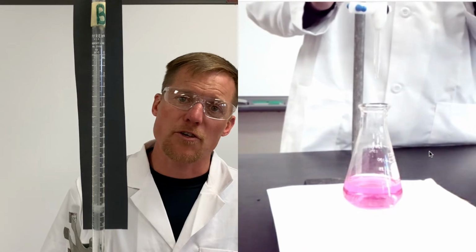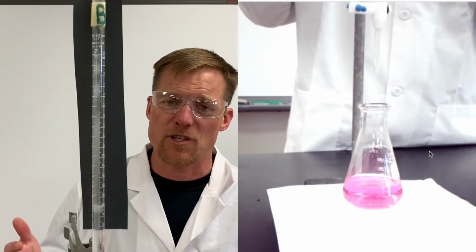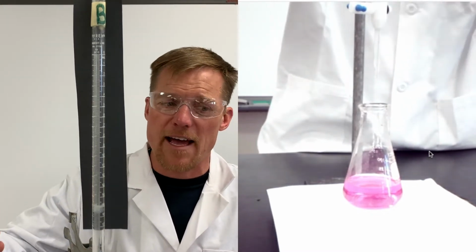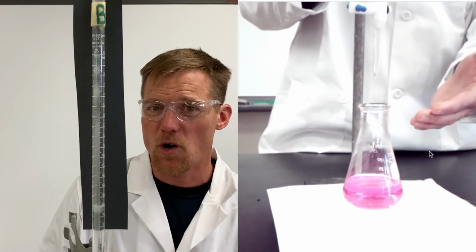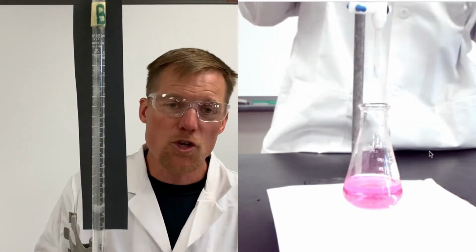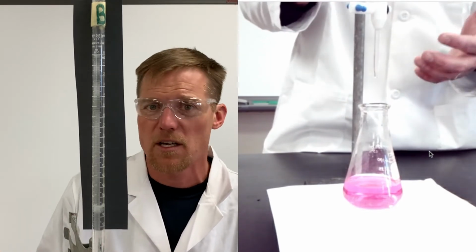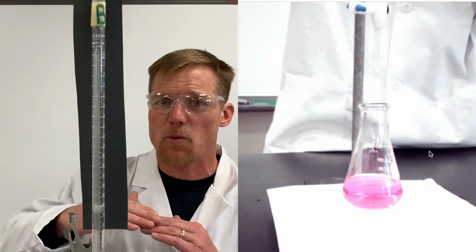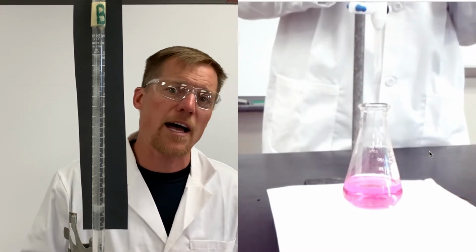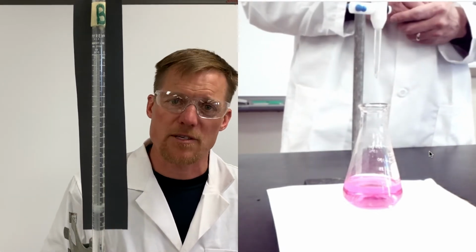The lab calls for using 15 milliliters of acid and base each time. We've filled our burettes with 50 milliliters of acid and base, so we could actually run the trial 2 more times based on what we just saw. You might have a lab in college that calls for you to only use 10 milliliters. That's fine too. Just remember, when you increase your sample size, you get more precise. So using a higher volume as opposed to, let's say, 5 milliliters is gonna give you better results.